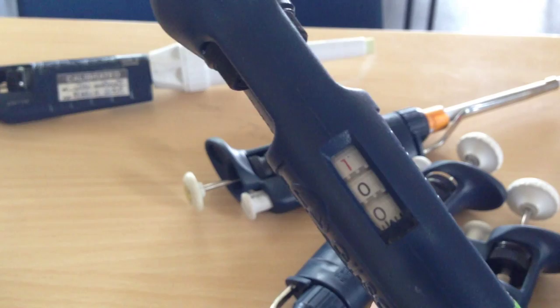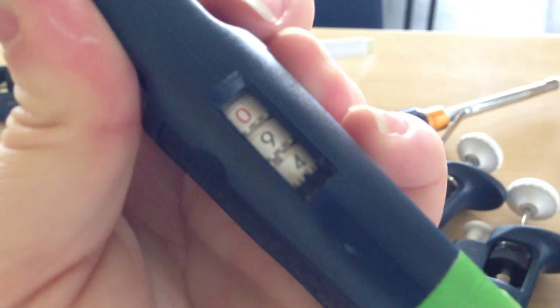Now it's slightly different on the big ones. Because this is a P1000, if I just show you that. It says 100 on here, but it doesn't actually mean it's measuring 100 microliters. It means it's measuring 1000 microliters.